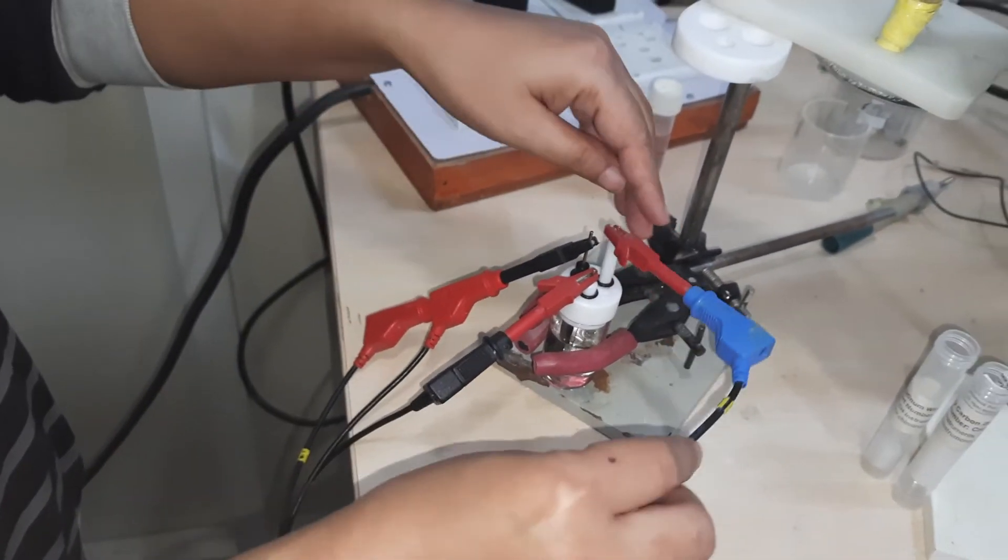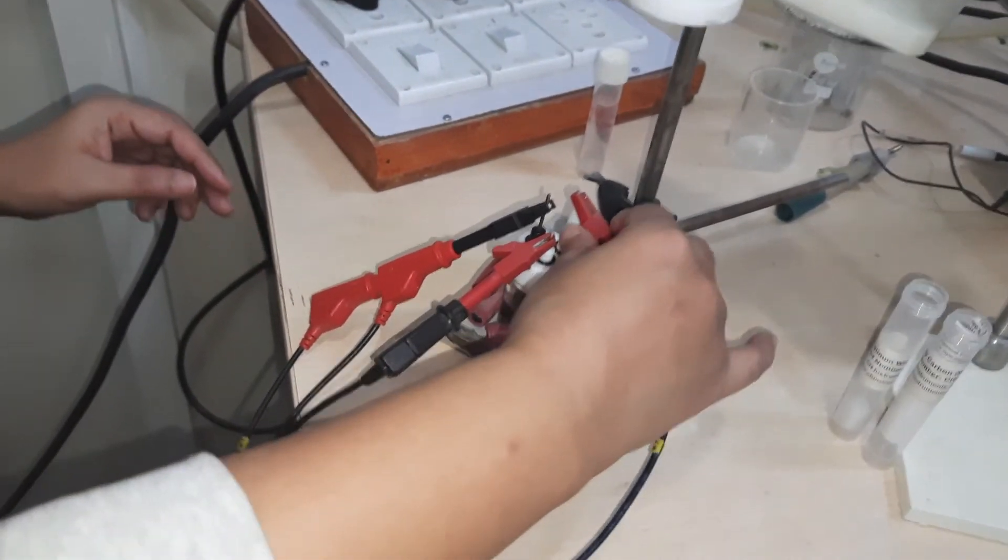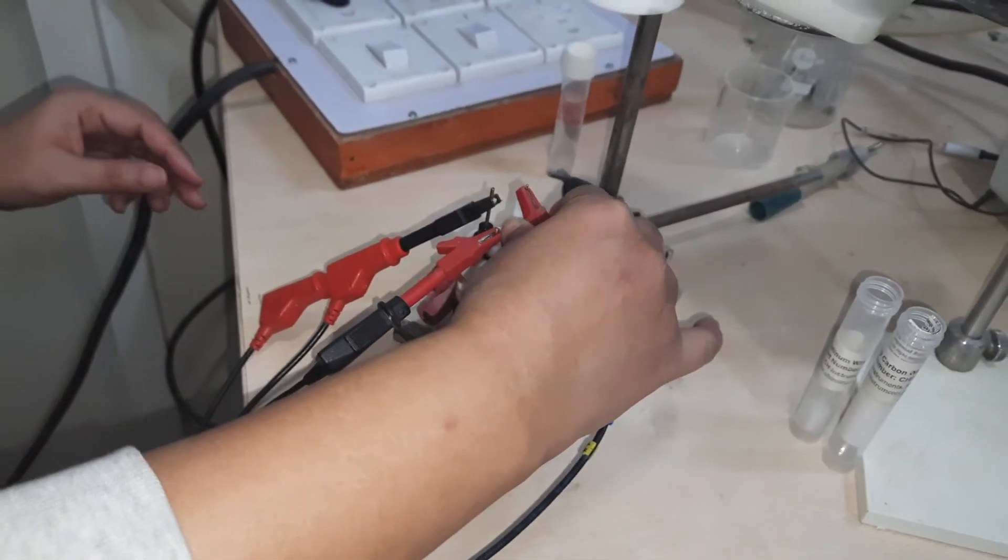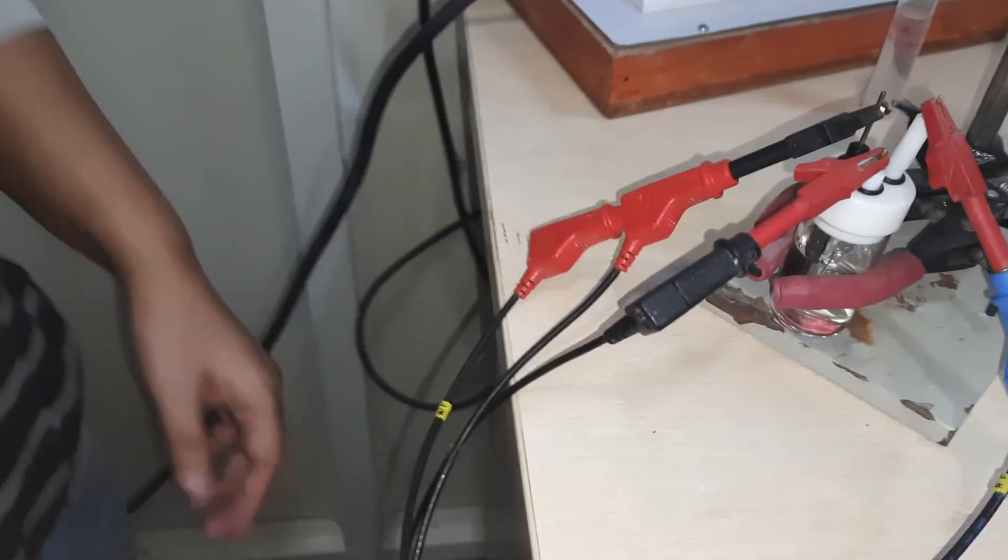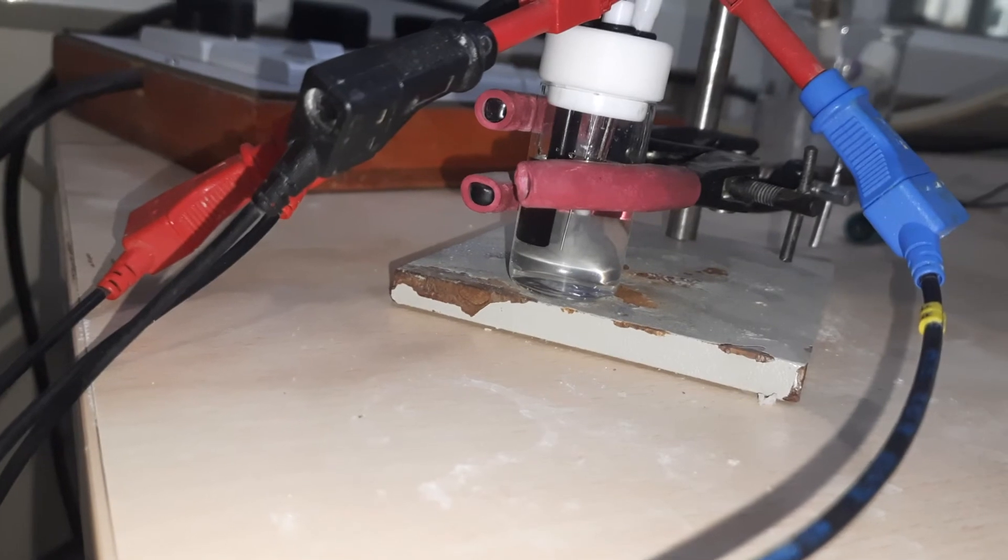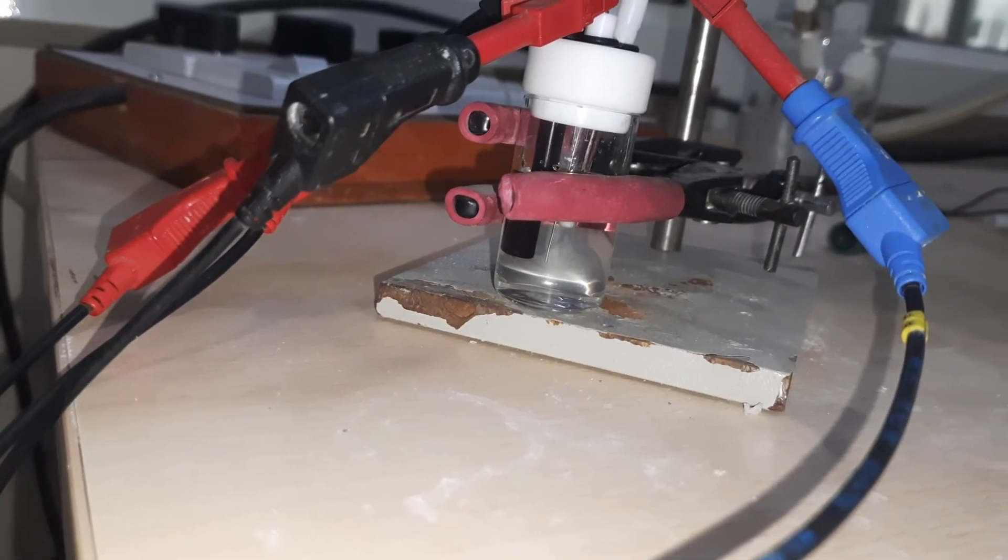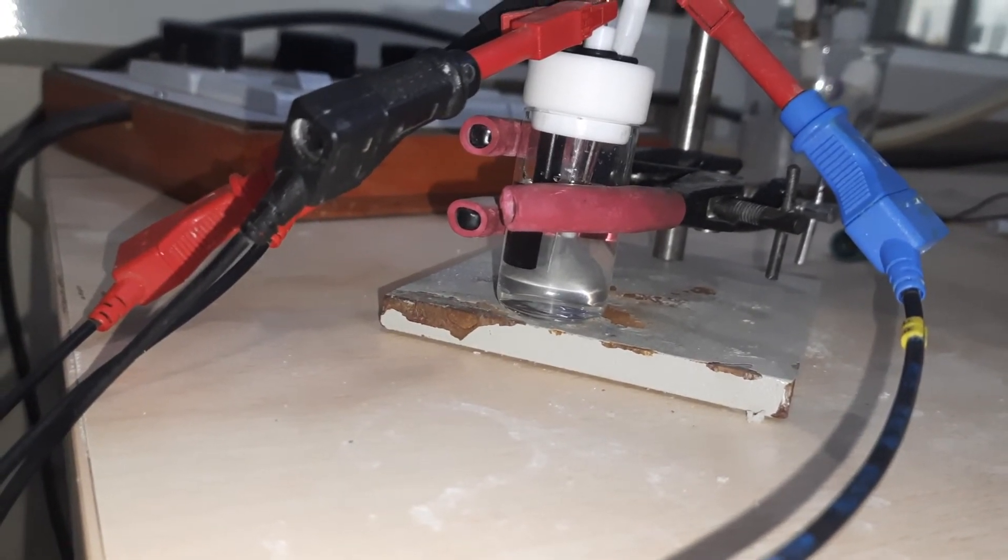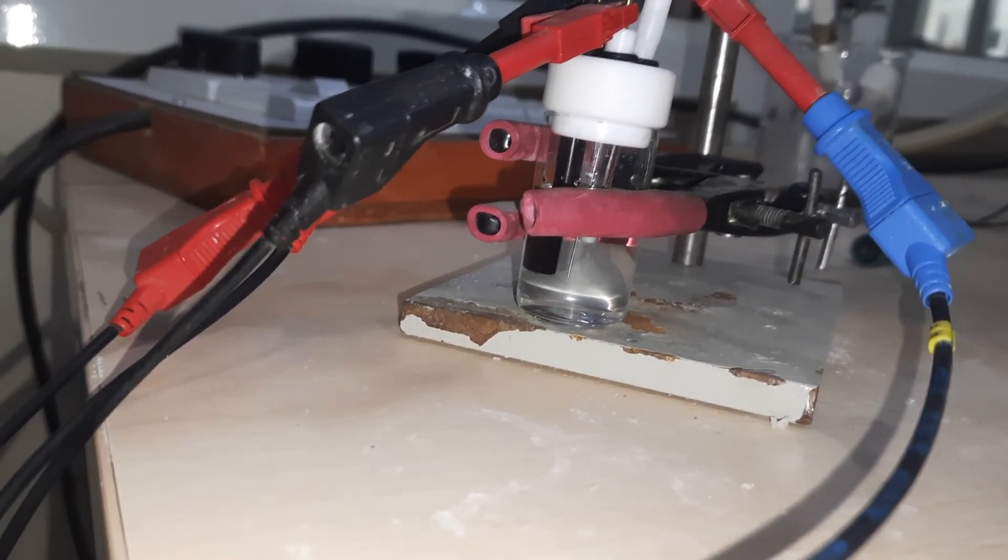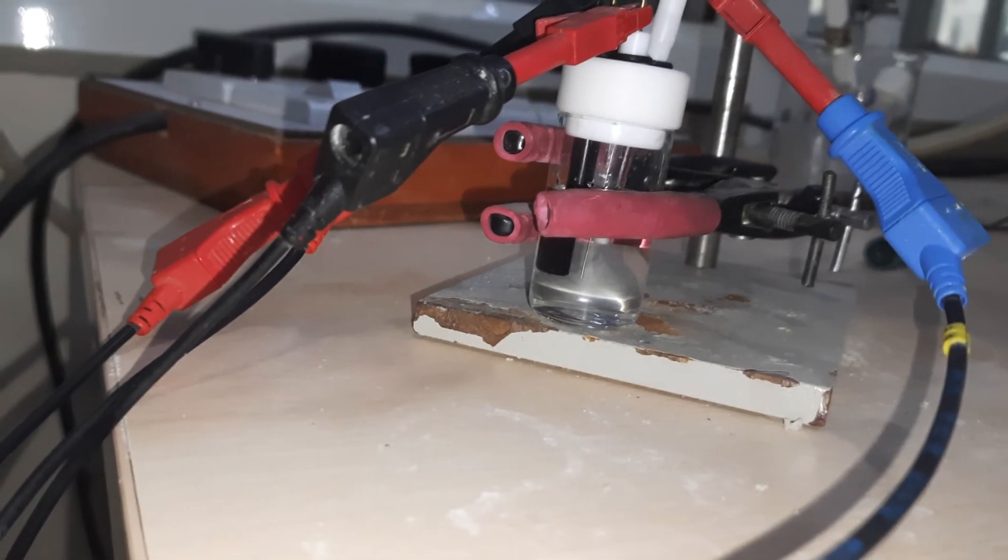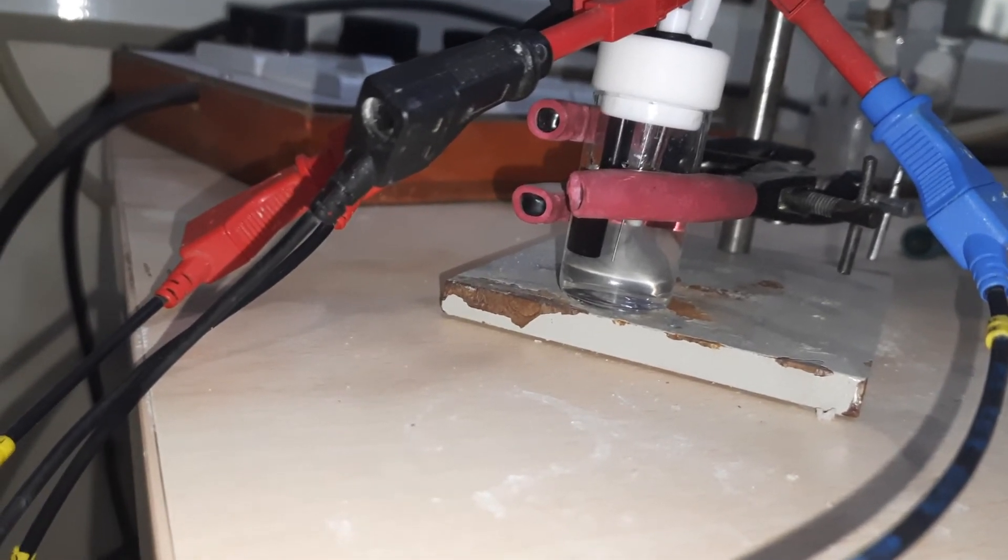You need to be careful with the electrodes - they need to be close to each other, but at the same time they should not be touching each other. You can see clearly that three electrodes have to be deep in the solution.